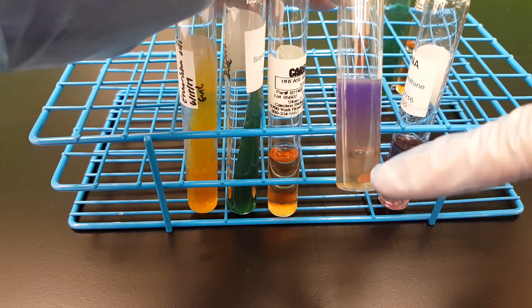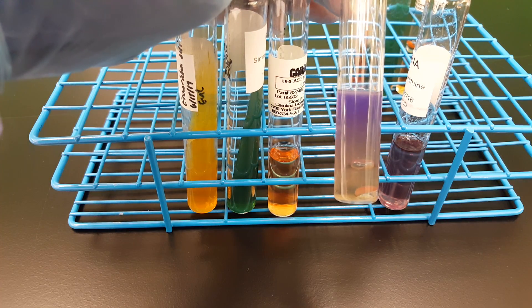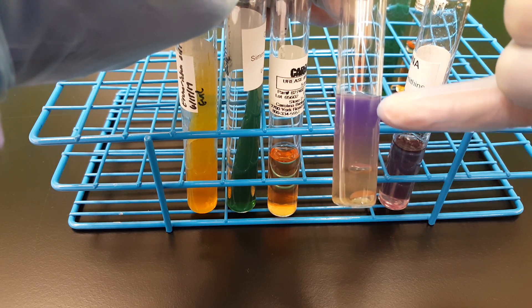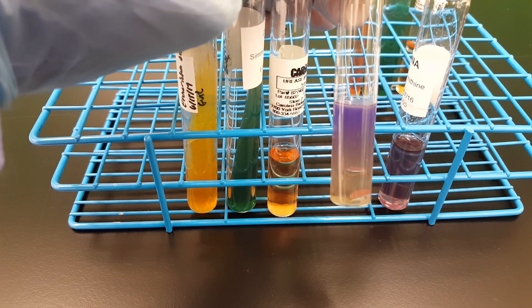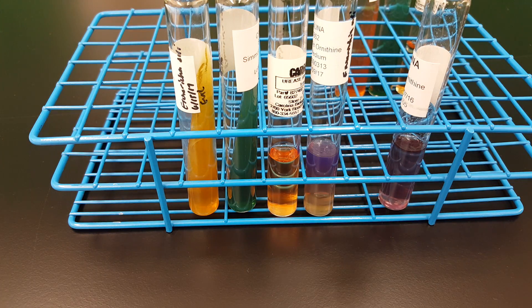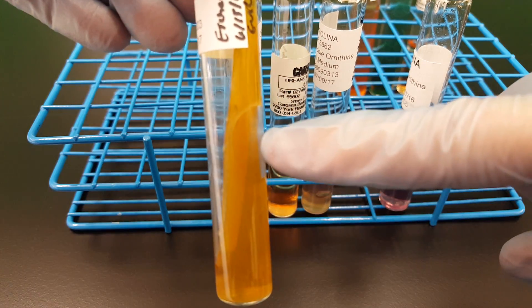With the ornithine — the O of MIO — ornithine is an amino acid in the media that is utilized by the bacteria. If the organism decarboxylizes it, growth causes a cloudy grayish-purple color. If it were yellow, that would indicate no decarboxylation of the ornithine amino acid. You can also see there's gas production in here, which was demonstrated also in the TSI slant that we saw earlier.